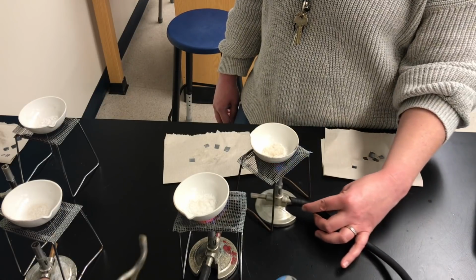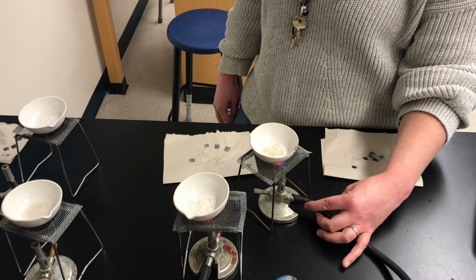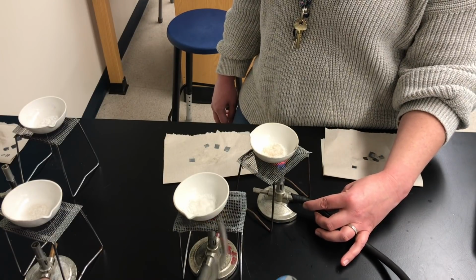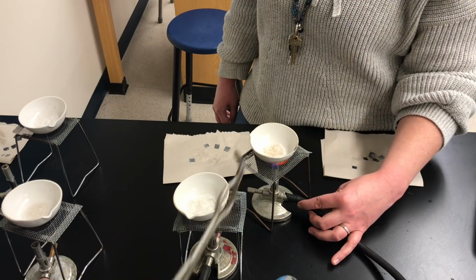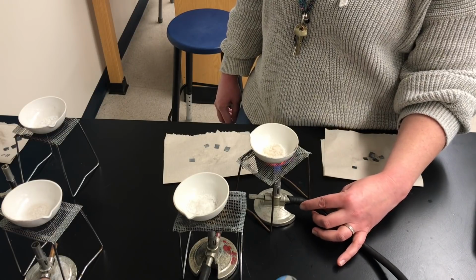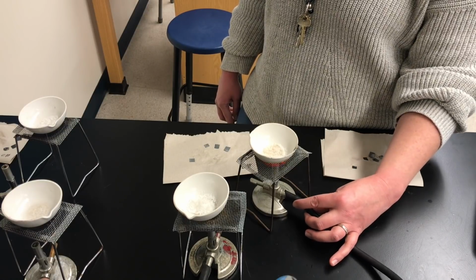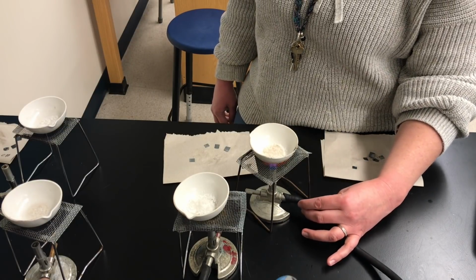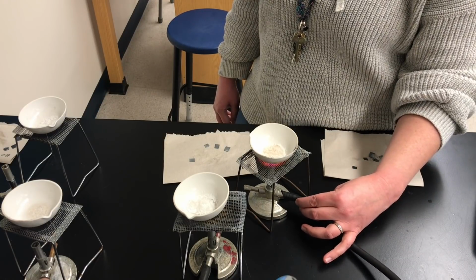So this is our third dish. It's now finished. And Ms. Watts is just heating the 4th dish there to dryness. For some reason, the zinc chloride in that 4th dish is a little bit discolored, isn't it? It is, yes. It's not its white color. It's got a bit of a brownish impurity. I don't think that'll affect our results, but you might want to note that if you're watching this from home.